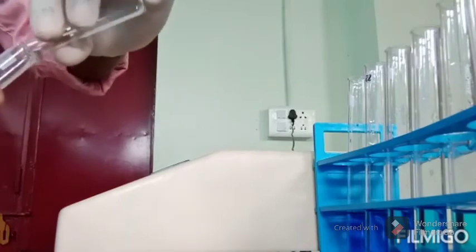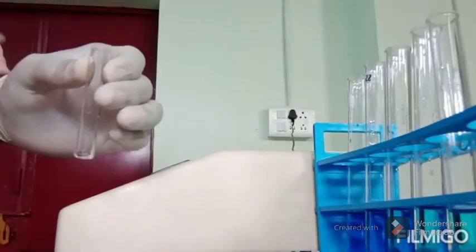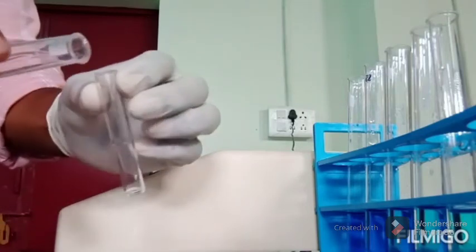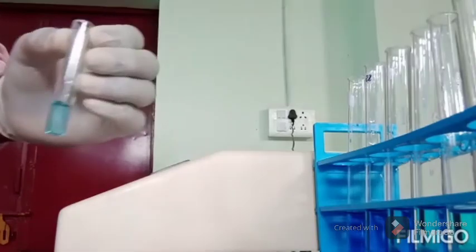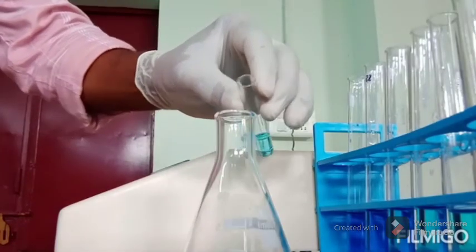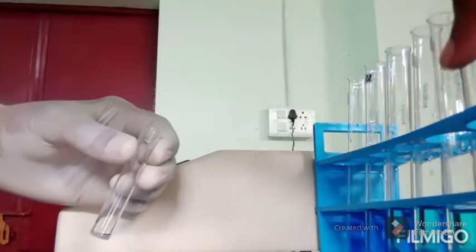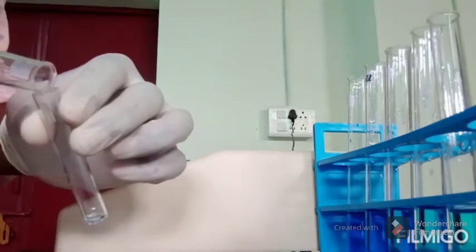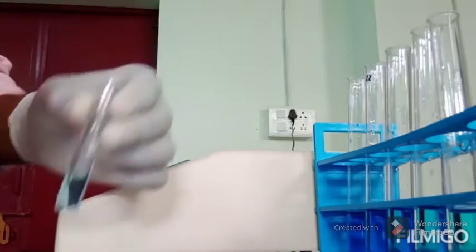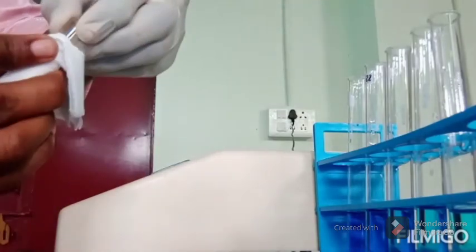Now here, make it a practice that after taking reading of a solution, you pour it back to the same tube, tap the cuvette on the tissue paper, and rinse the cuvette with the next solution that is to be read in the instrument. So like this. You can discard that solution. As also, you have to wipe the cuvette. After adding the next solution, you have to wipe the cuvette with a tissue paper before next reading to get rid of water or fingerprints which may be there on the glass cuvette.